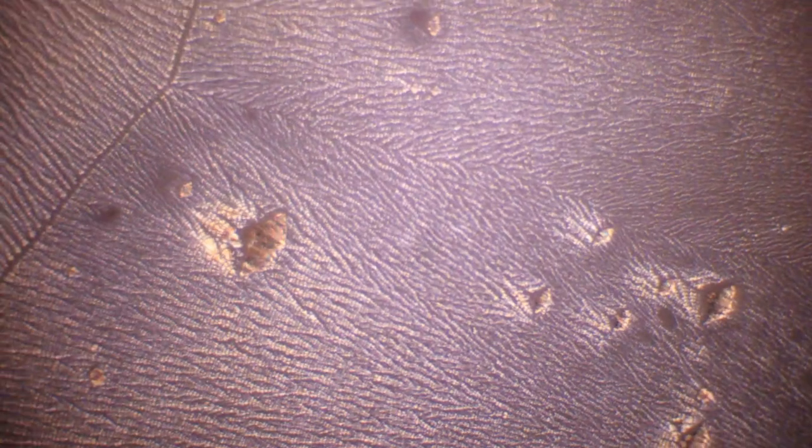Here there are several layers of sticky tape overlapping. I can change the colors by rotating the analyzer in the objective. See how the colors change. It's a little bit washed out now because of the high light intensity. By rotating the stage you also get the color change. It's not quite centered, that's why it's not going in a perfect circle. That was the sticky tape.